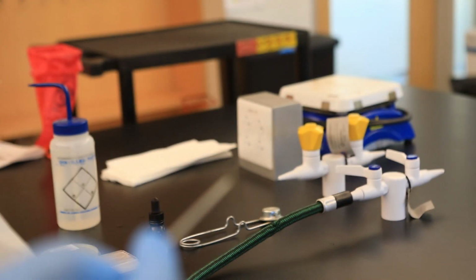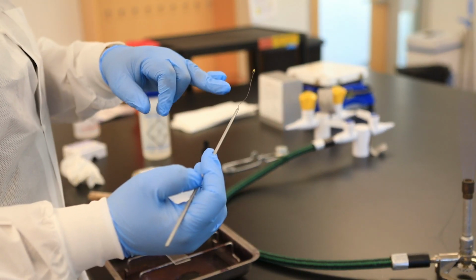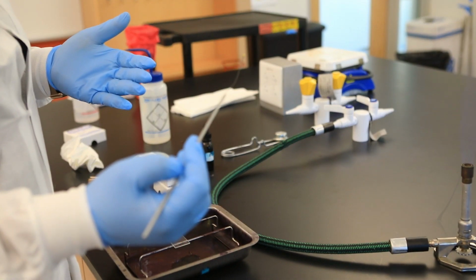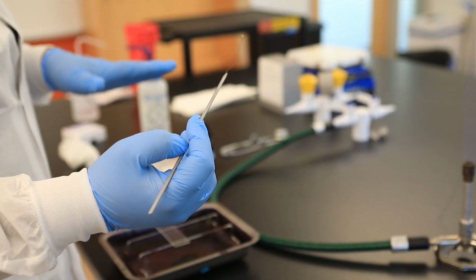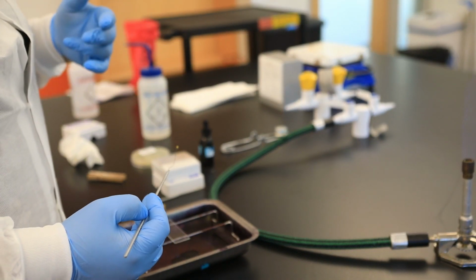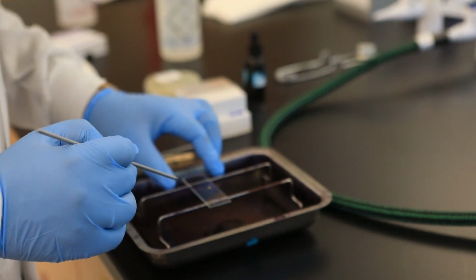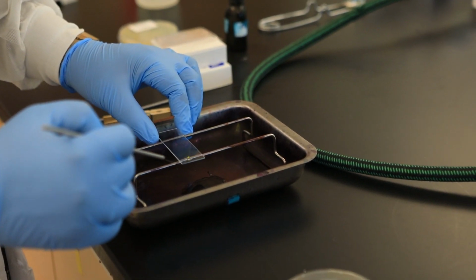Okay, so I know that we're very visual people, right? You don't have to see clumps and clumps of bacteria. You don't want to collect clumps because that can make your bacteria smear very thick. And we want to make sure that our bacteria smear is thin. The reason why you want the smear to be thin is that it allows for adequate drying time, and most importantly, it allows for the stain to penetrate the cells. Okay, so what I'm going to do now is take the bacteria and mix it in with the water.